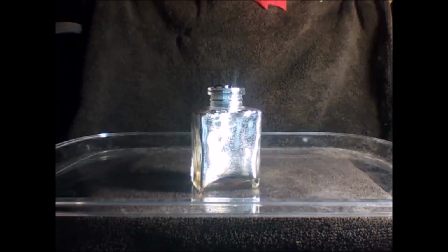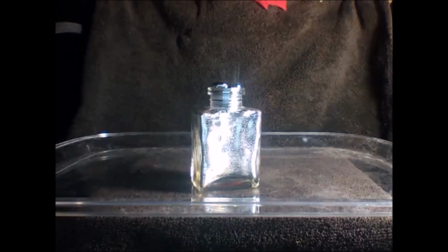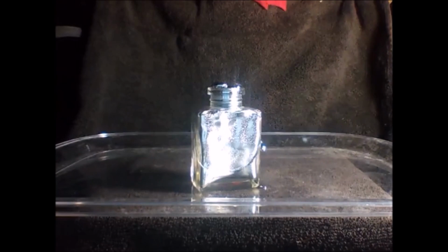The video is now being played at 64 times normal speed, and you can see that the gallium is expanding as it cools, forcing its way through the open top. But once the gallium at the top freezes into a plug, BAM! It breaks the bottle and it starts squeezing out the side. The poor glass bottle didn't stand a chance.